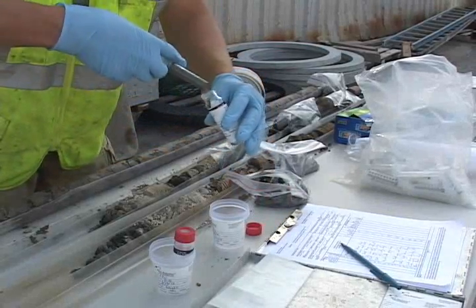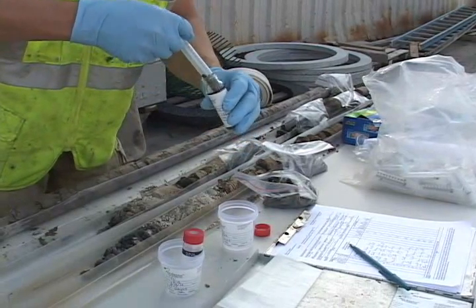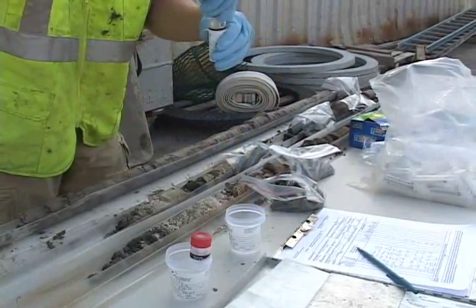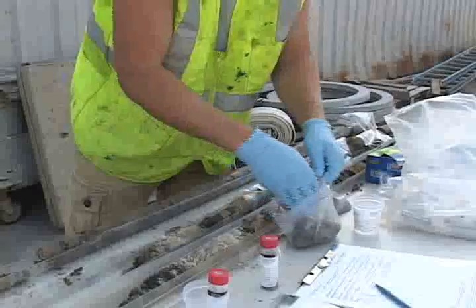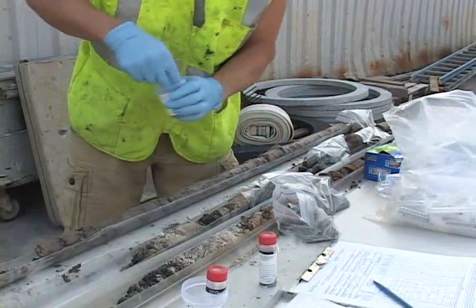Some state regulators should be looking at a change in methodology, because this procedure creates a strong negative bias. From the sample baggie, soil is also taken for a dry weight. This is required for every sample that is sent to the laboratory, and must be taken from the same interval from which the methanol preserved sample is taken.